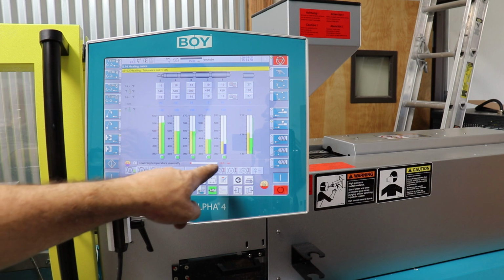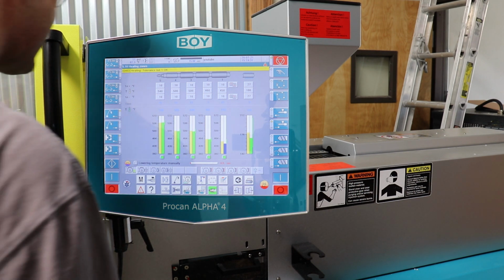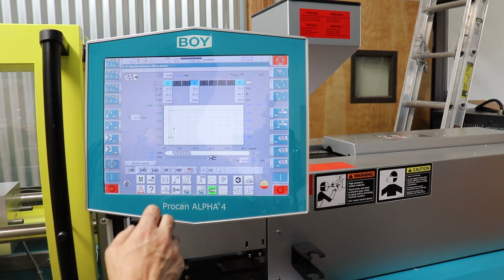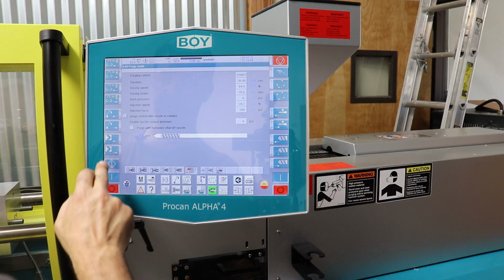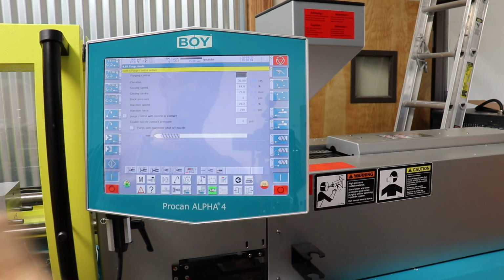So in about 14 seconds, we can start to purge out the plastic. Basically the machine will back its nozzle out and start cycling plastic through its injection unit. So let's do that now. We go to the nozzle page, and then we're going to hit this button here, which is the purge button, and I'm going to hit start. I hope. Oh, I've got to turn the pump motor on. Get into manual mode and then hit the start button.